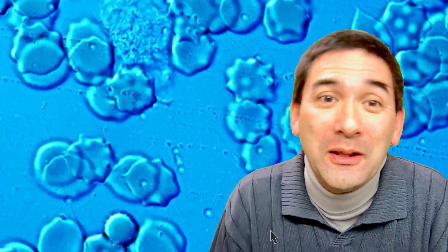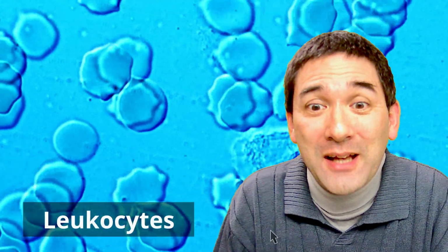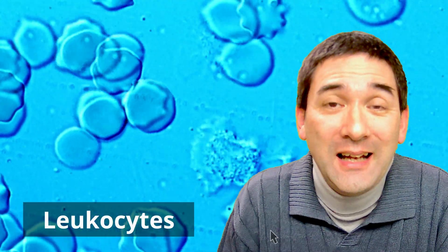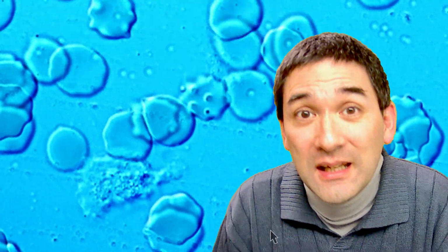And while I was talking about the red blood cells and the hemoglobin all the time, you can see in the background, of course, also the white blood cells doing their work. And this is now going to be the next cell type that I would like to talk about. The white blood cells, they are also known as leukocytes, and they essentially are there to protect the body from disease. And there are two ways in how they are able to do that.